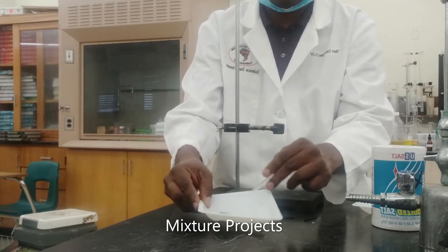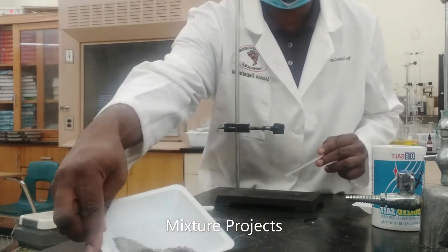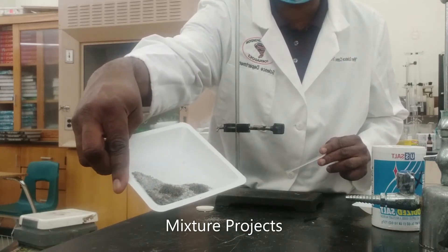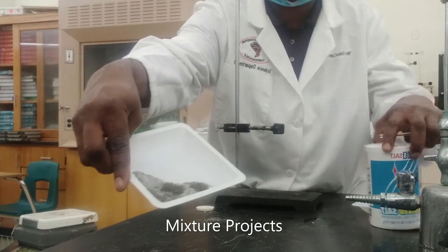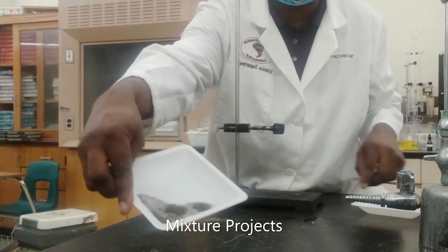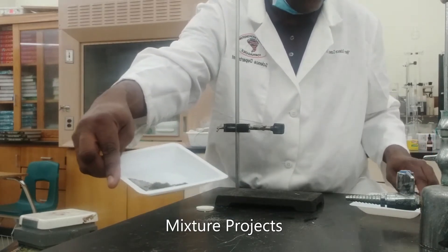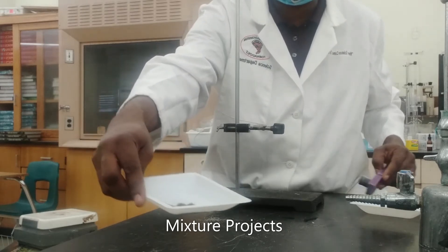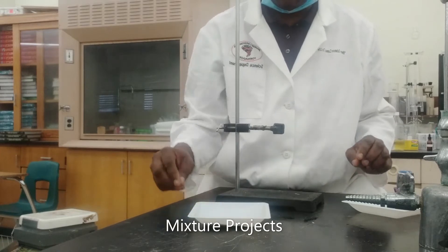Alright, so right here we have a mixture of sand, salt — sodium chloride, our regular table salt — and some iron filings. Now we know that iron is ferromagnetic, meaning that it has some magnetic property.